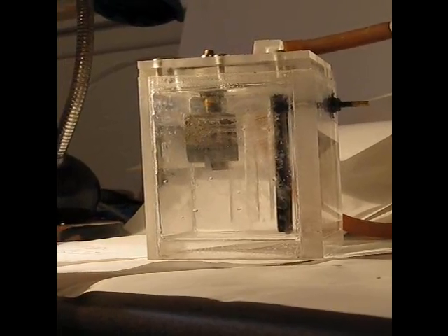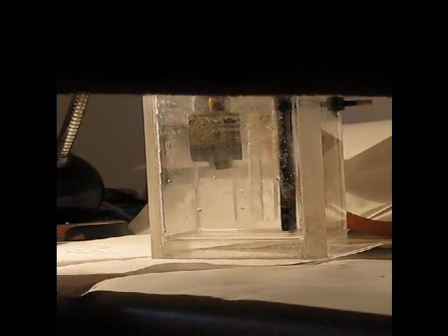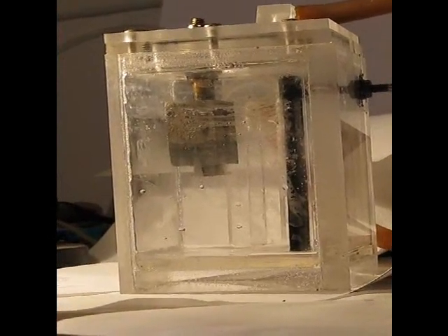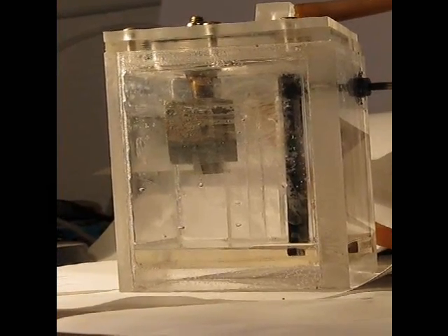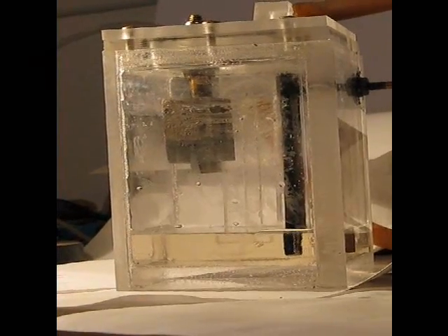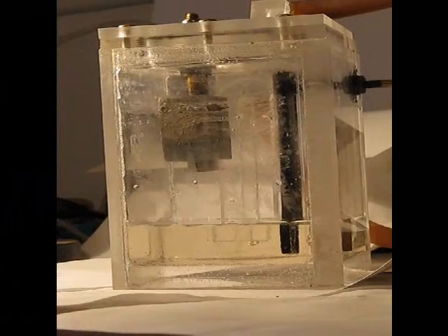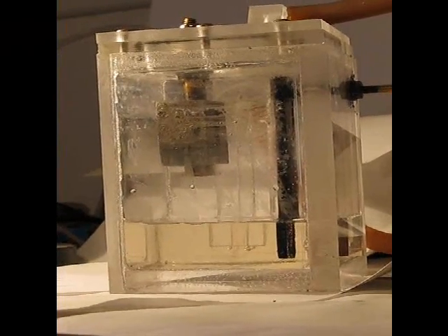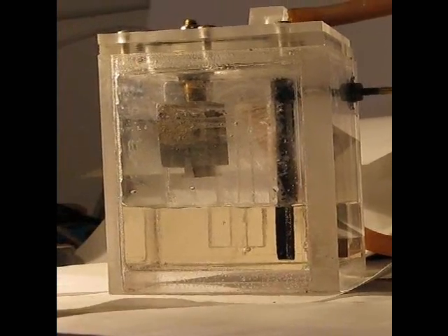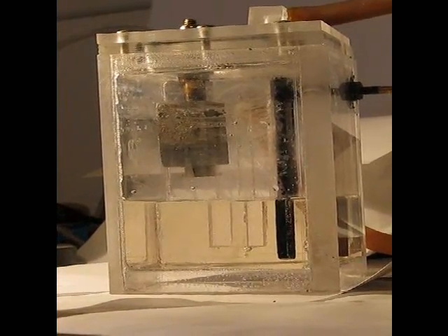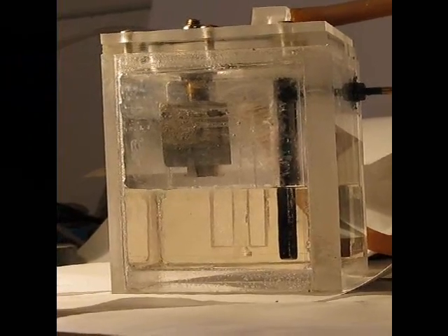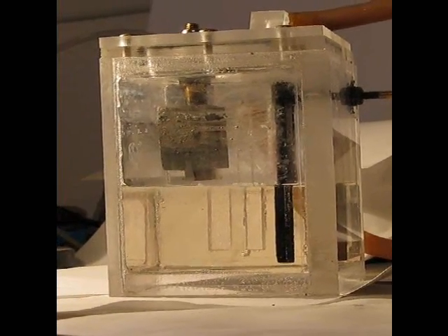I'm going to add the chemistry right now. As we know, aluminum will react strongly to a strong base producing a fairly violent reaction producing hydrogen. What I want you to note is that as the chemistry comes up and the aluminum is immersed in the electrolyte, there will be almost no reaction.